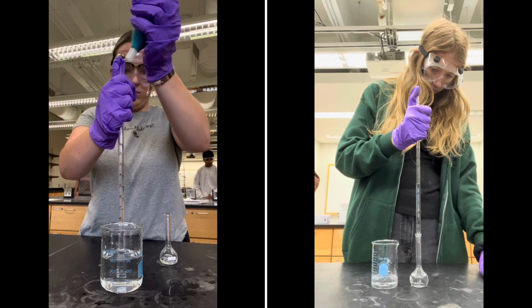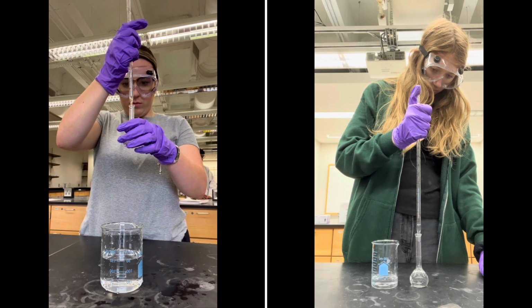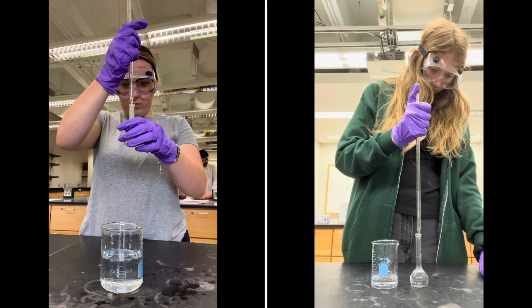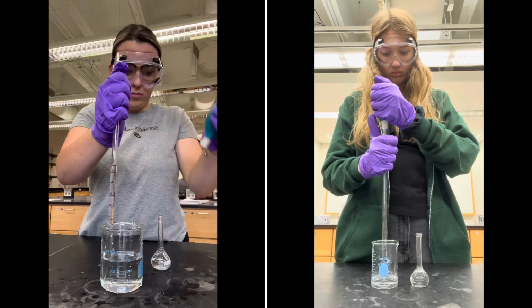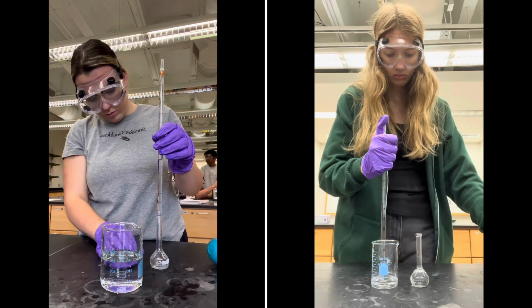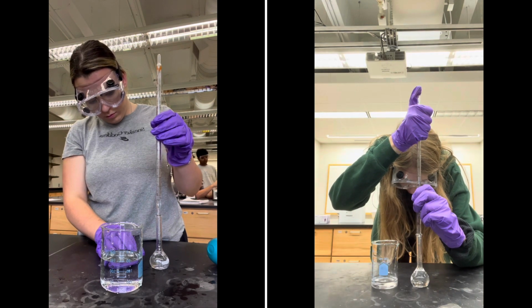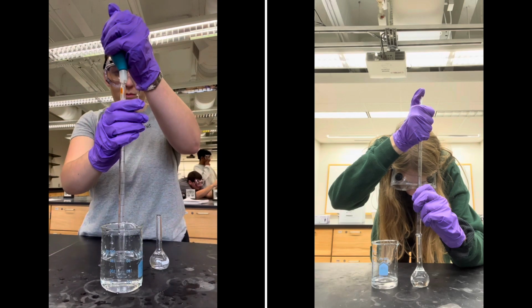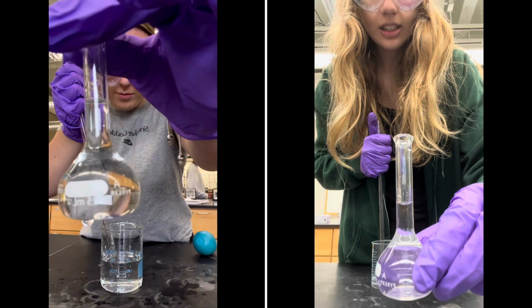You've probably heard the word meniscus mentioned multiple times in this video so far. The meniscus is the curve at the surface of a liquid in glassware. It is caused by the cohesive forces between liquid molecules and the adhesive forces between the liquid and the walls of the glass tube. This is also known as capillary action. In order to read a meniscus, you measure at the center of the curve that is formed, in this case, the bottom of the meniscus. The next clip is an example of the meniscus hitting right at the 25 milliliter mark on the volumetric flask.